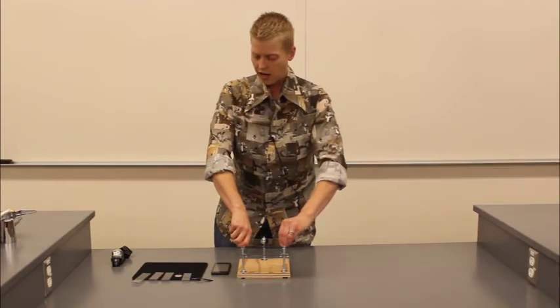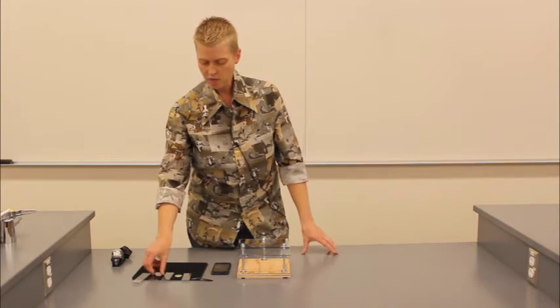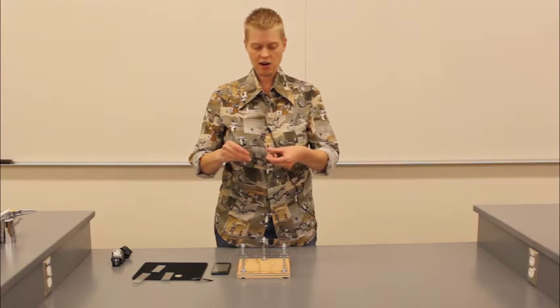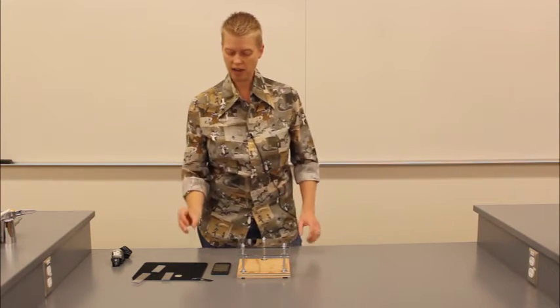All right. If you have any extra pieces of plexiglass left over, you can also make microscope slides, which are nice for putting specimens on. So I have a microscope slide pre-made here. It's got a piece of Elodea leaf, which is a floating aquatic plant that we're going to take a look at.